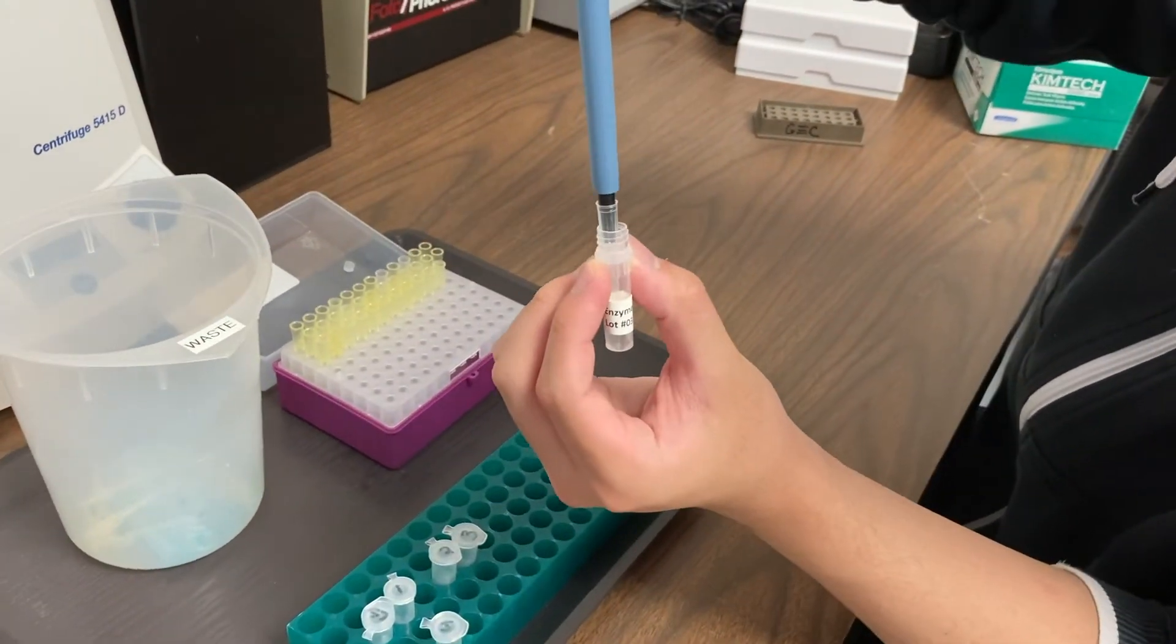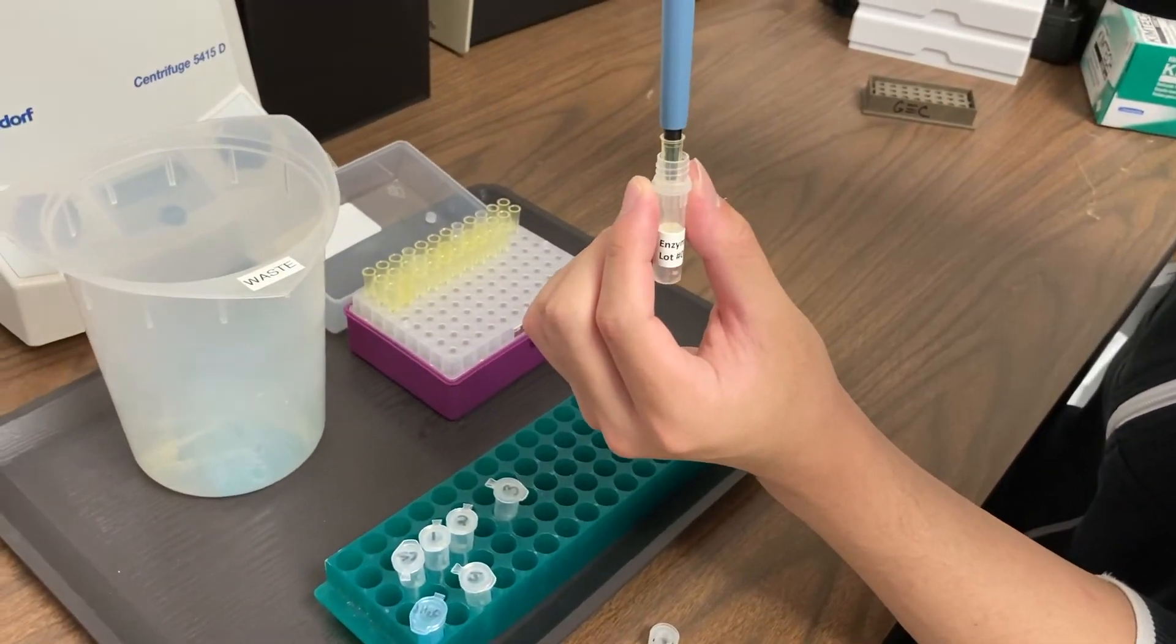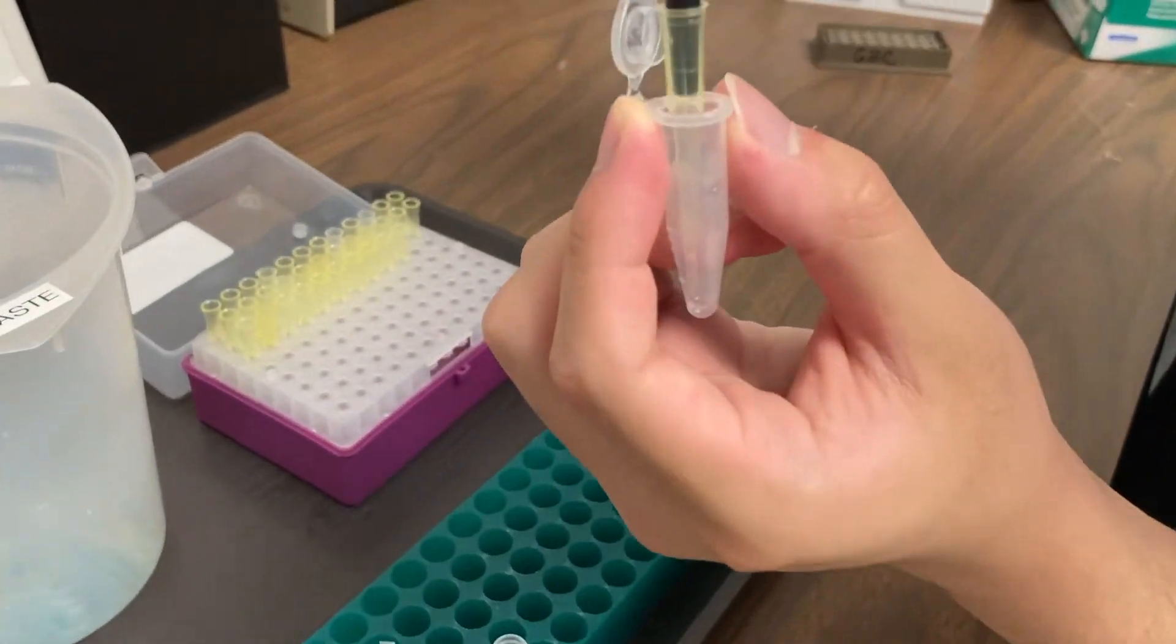Sample 1, Paul's DNA. Sample 2, Devante's DNA. And the last sample is Sample 3, Lucia's DNA.